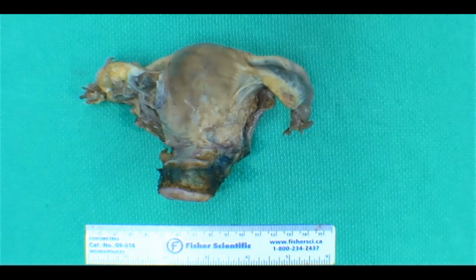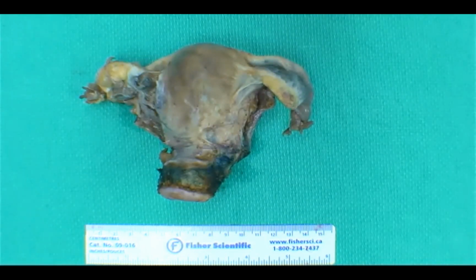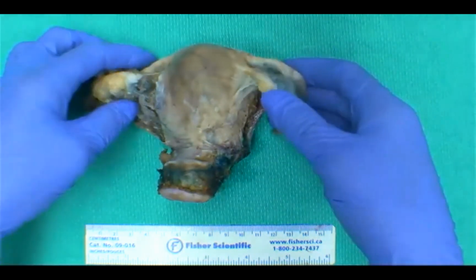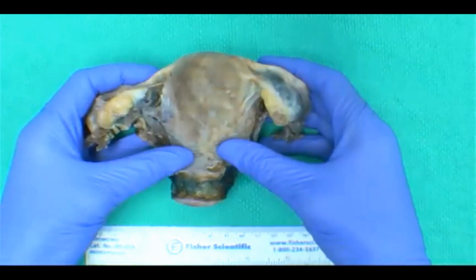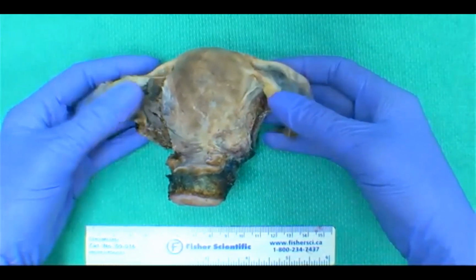Okay, so now that we've covered a majority of the benign reasons, what are some malignant reasons for a total hysterectomy specimen? Great, endometrial cancer, ovarian cancer, hyperplasia, Lynch syndrome, so going with our prophylaxis. Thank you. I was waiting for that. Yes, and cervical CA. Yeah, so I think we touched upon the major ones for malignancies. Before we go on, we'll go over the anatomy of the uterus and how you would orient these specimens if you receive them in the lab.